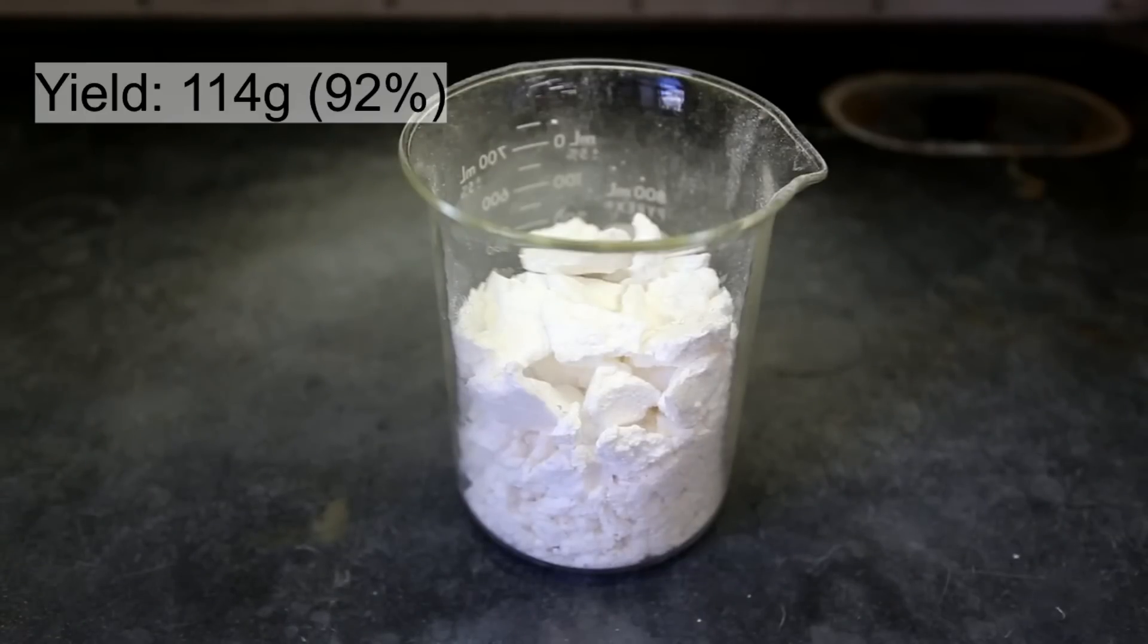This is the final product after drying in an oven overnight. The product had a melting point of 157 to 159°C which was very close to the theoretical 158.6°C.